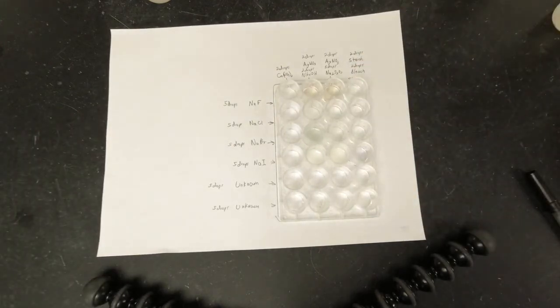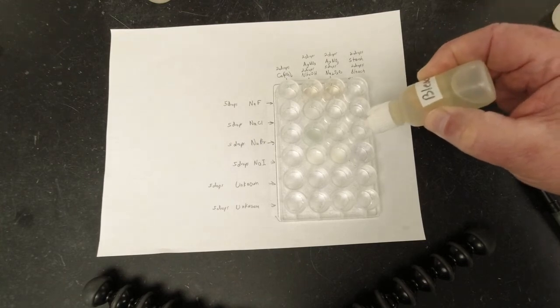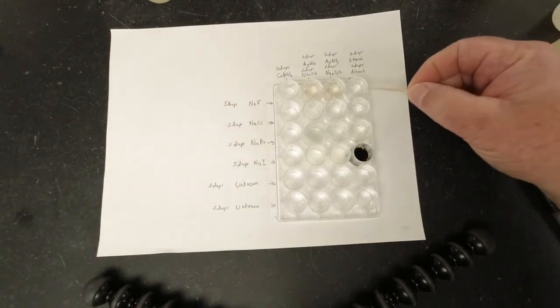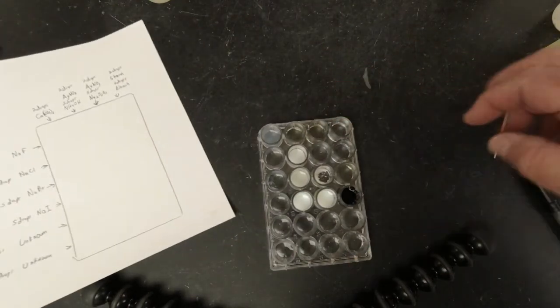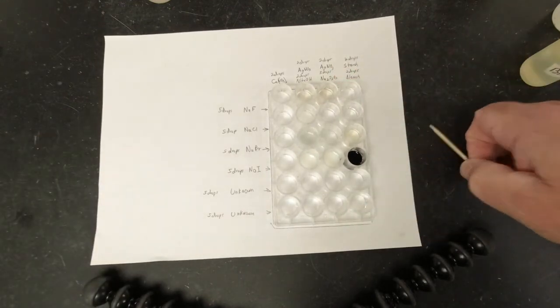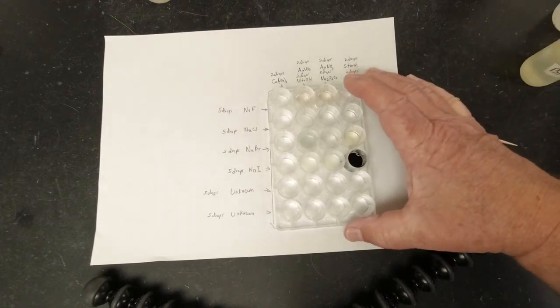But now I'm going to add 2 drops of bleach to each. Oh, holy cow, something pretty amazing happened here. In each one of these, there seems to be no reaction, so nothing changed. If I take that away from the white paper and put it back there, you can see that those first 3 had no reaction. But this one turned black. Iodine's the only one that turned black with the starch and the bleach both in it. That would be a good thing to note.